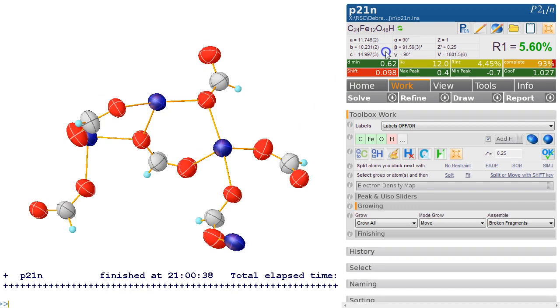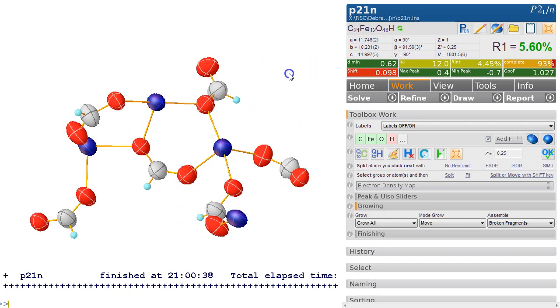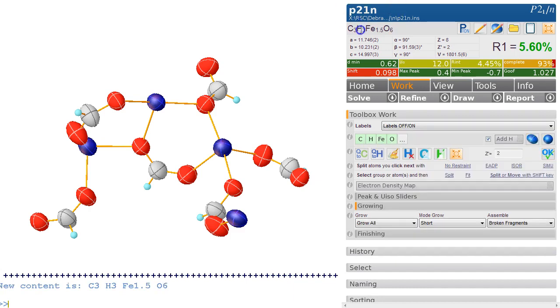Now to me that looks like it's a structure that's probably known. We need to find out the formula unit of this. So at the moment we've got Fe12. Well, that's not really very sensible, but that's because Z prime is set to 0.25. And let's just say we set it to 2 and see what we get. So this is now C3H3 Fe 1.5. That's not very useful. So we could set it to 4.